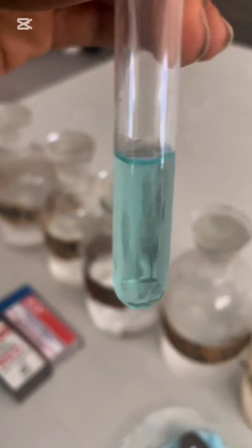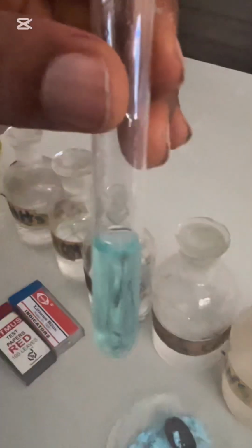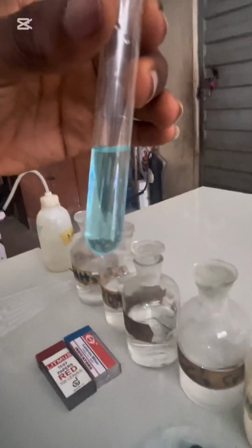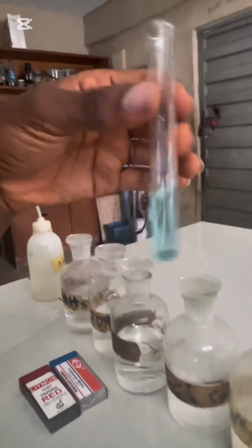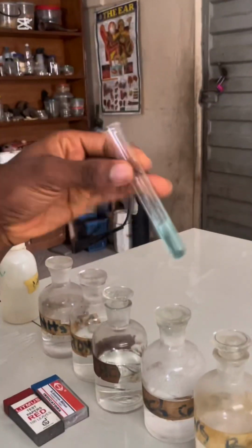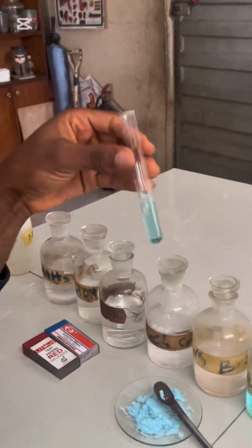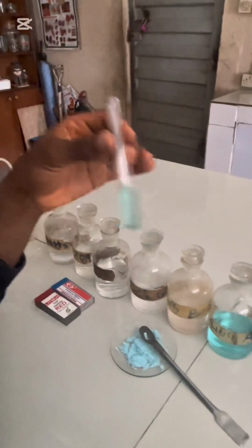In my inference, I'm going to say sample C is a soluble salt. And underneath, I'm going to say original solution formed. I'll represent it with OS, because it's already dissolved. I'll be taking all of my sample from here in case I'm asked to divide into portions.